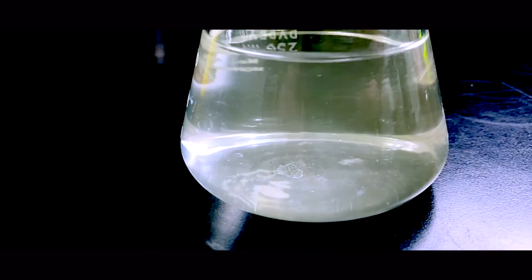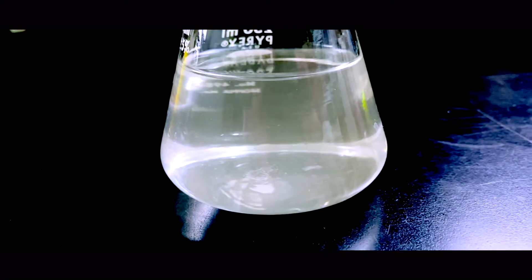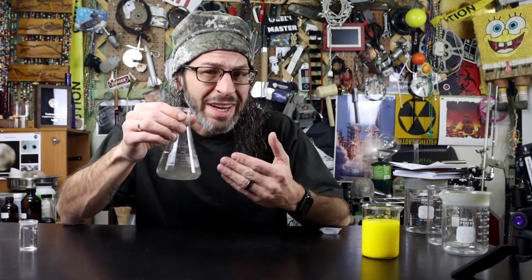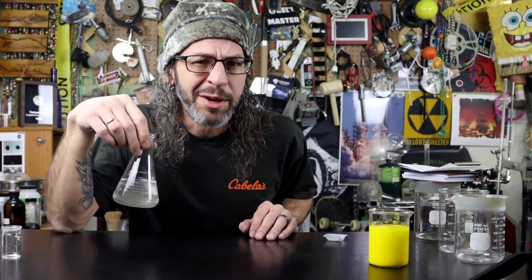There you have it — a solution of silver nitrate. All of the silver nitrate crystals that we put in have now dissolved. They're still in there — they've just dispersed amongst the water. It makes a clear, colorless solution and you can't see any crystals of silver nitrate, so we would say that it's totally dissolved. That's the solution — it's as simple as that.